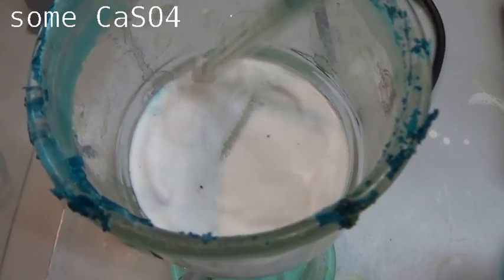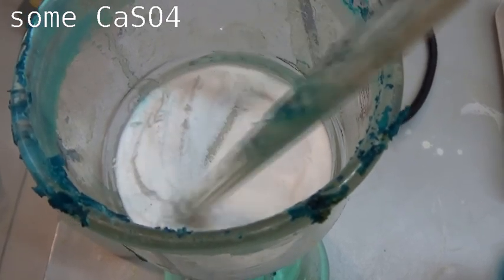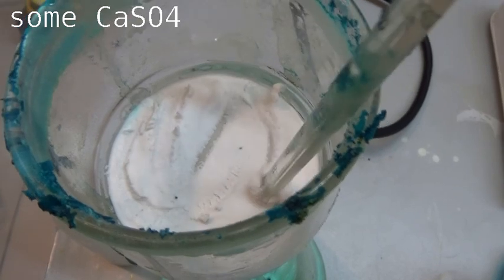Additionally, if you want to recover the calcium sulfate you have to wash it with hydrochloric acid to get rid of water insoluble side products. After the filtration you could just use the solution for the next step, but I wanted to get a crystalline product.